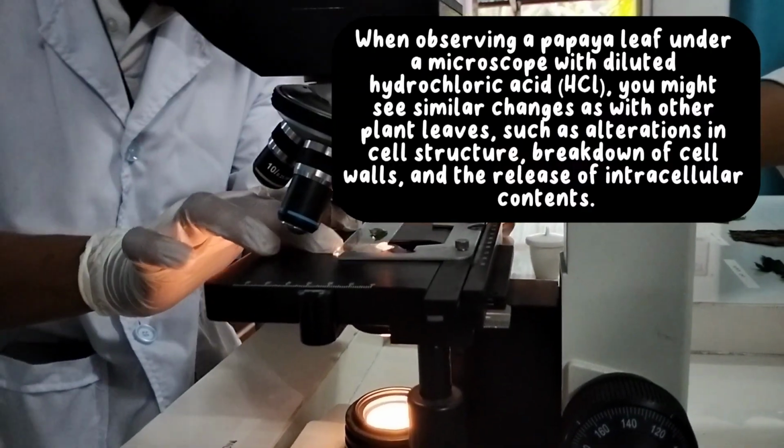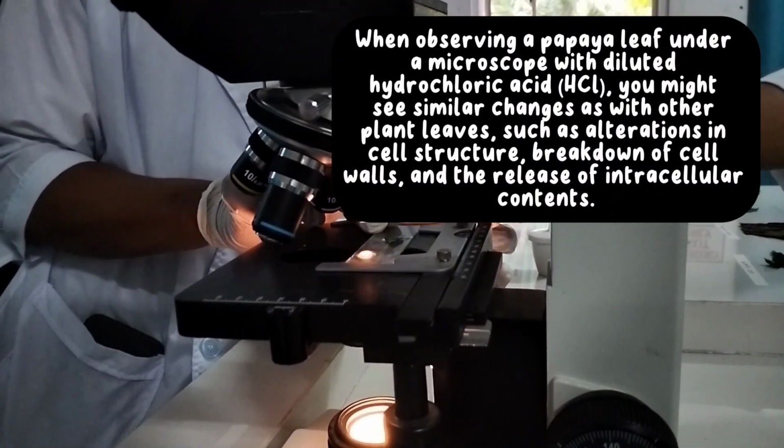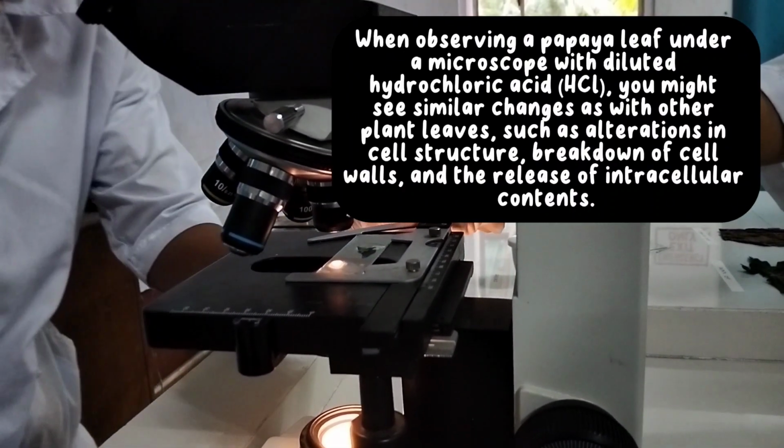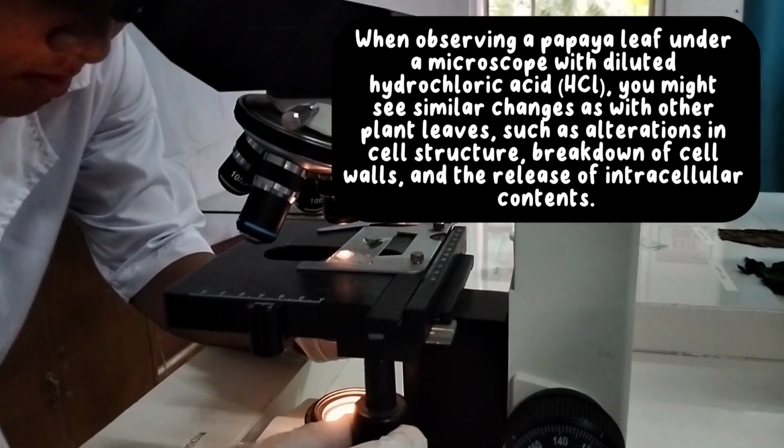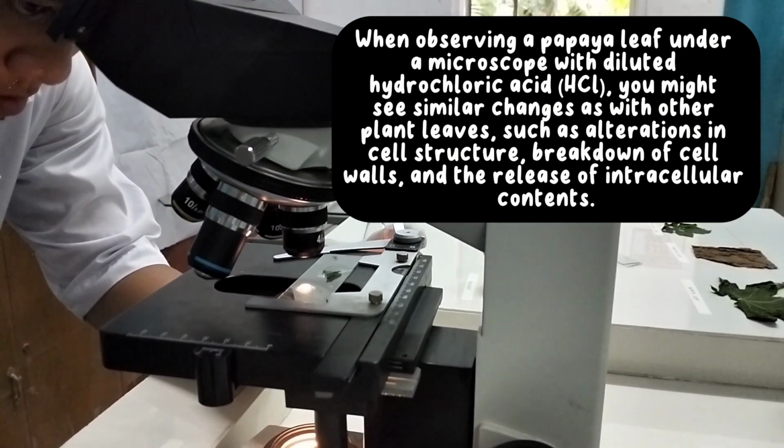When observing a papaya leaf under a microscope with diluted hydrochloric acid, HCl, you might see similar changes as with other plant leaves, such as alterations in cell structure, breakdown of cell walls, and the release of intracellular content.